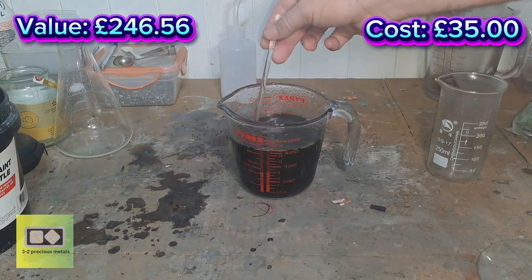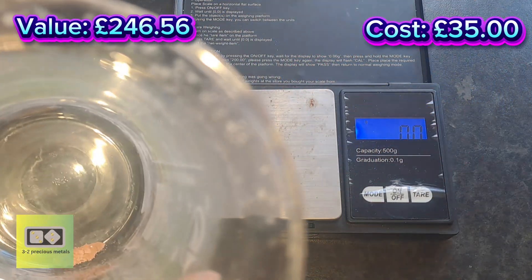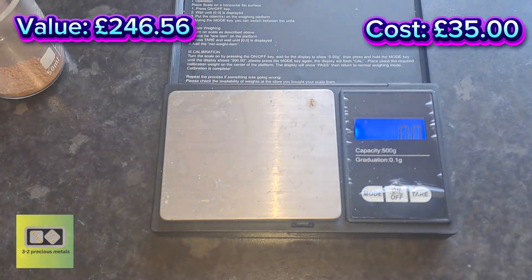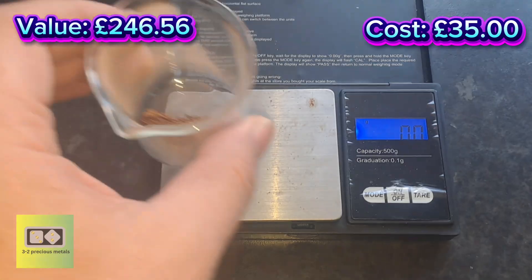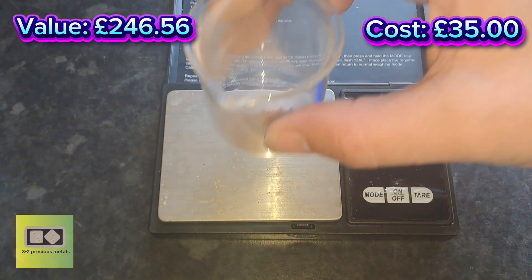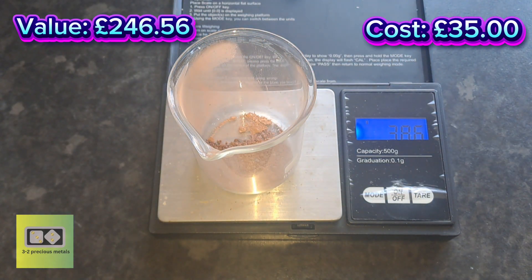The reaction is not great — I'll leave it to settle and then we'll get it weighed up. Here's all the gold precipitated from those small ICs and those transistors — it's really not a lot. We've got 38.6 on the scale — it's not even moving the scale. Less than a tenth of a gram. Well, that was a complete waste of time.